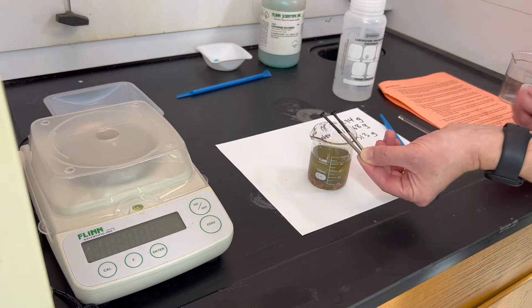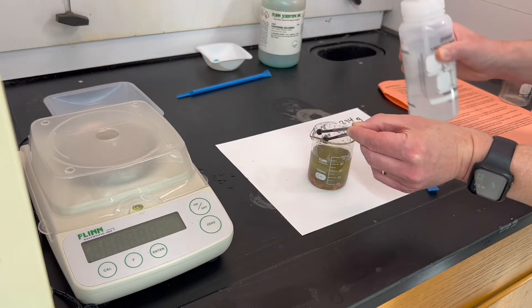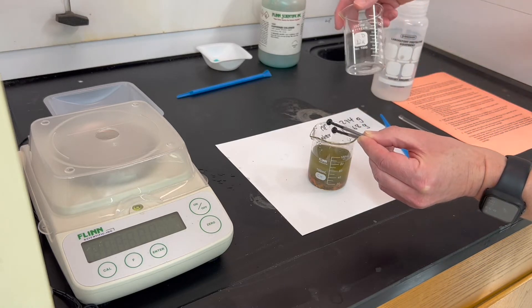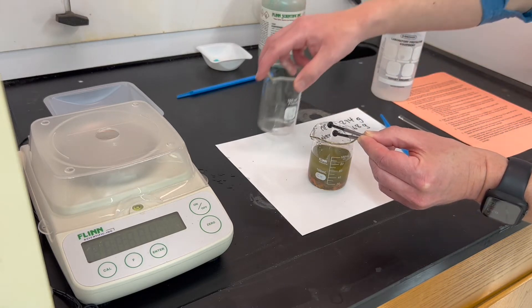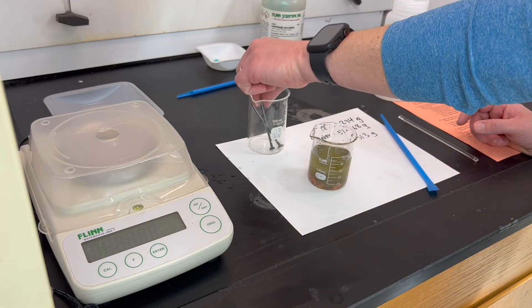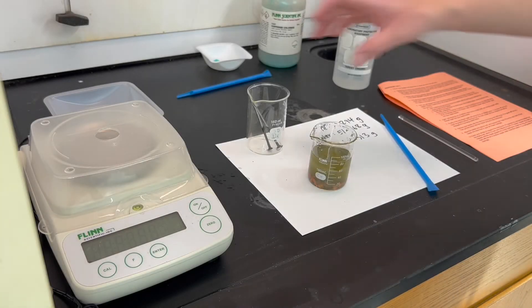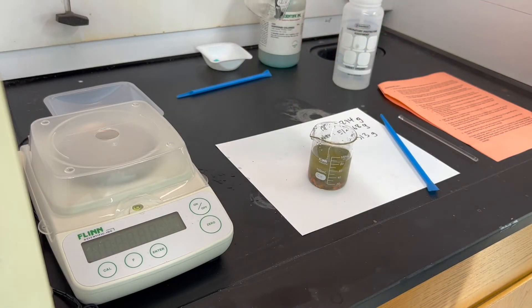Once you feel you have the copper removed from the nails, place them in another beaker — a 150 milliliter beaker is a good fit. Those nails are going to be dried; I want to know the mass of iron that's left, so they'll go to the drying oven.